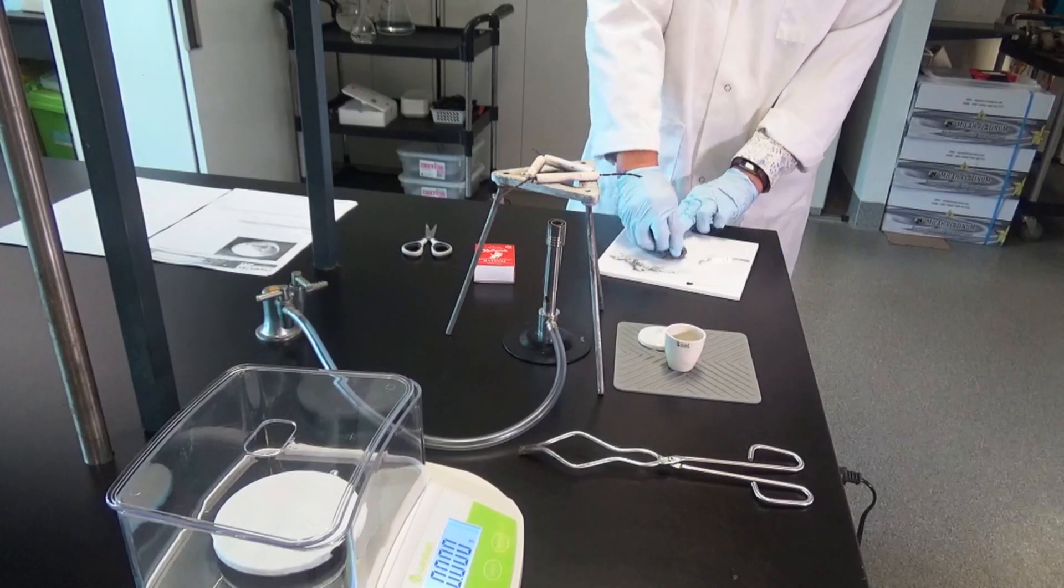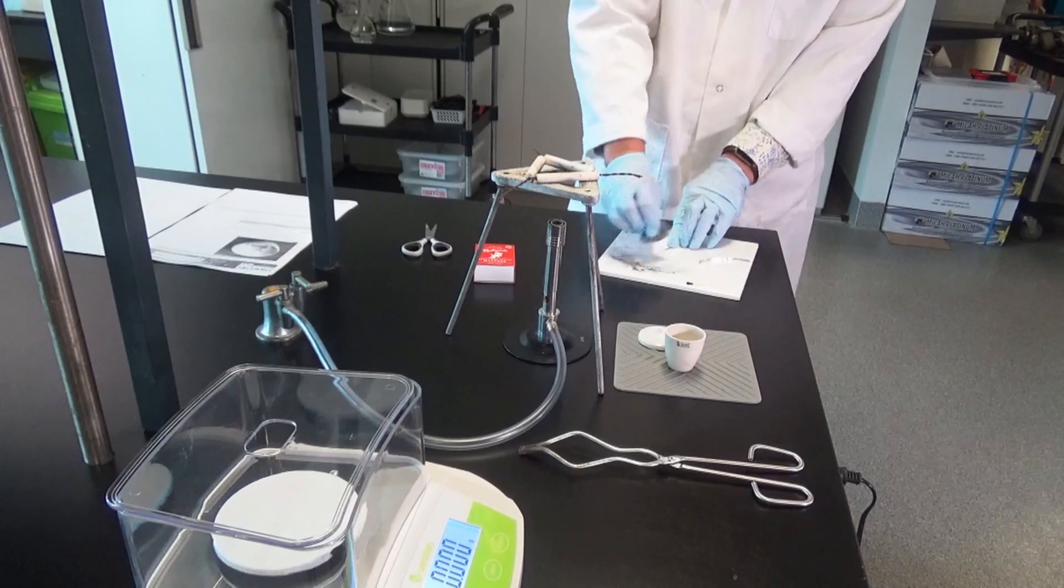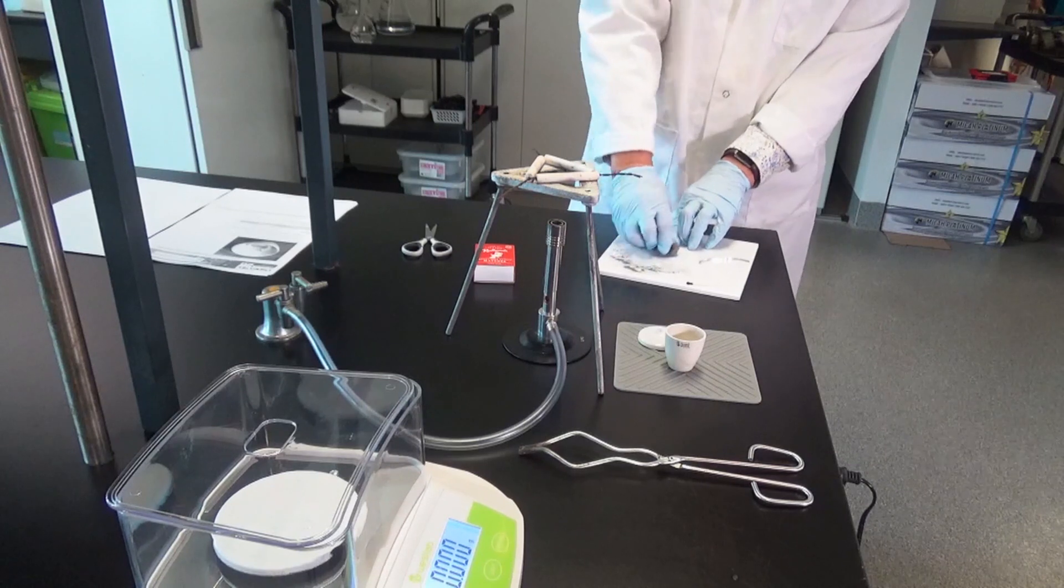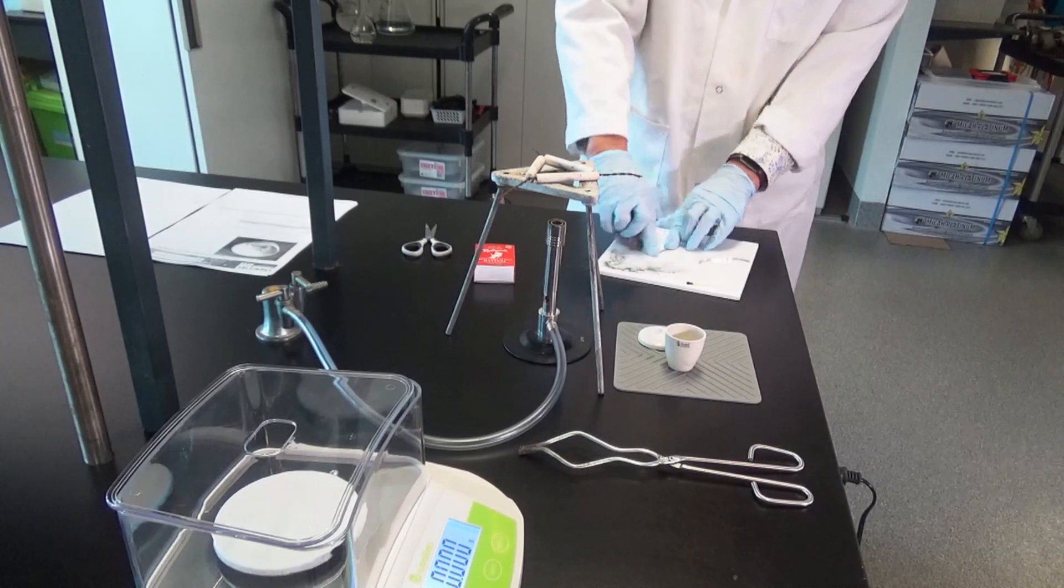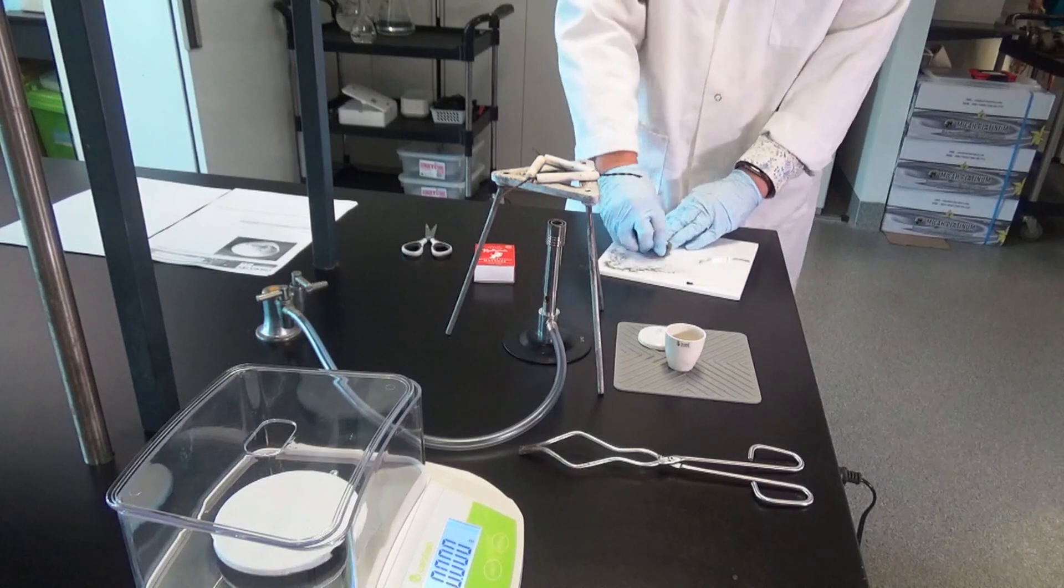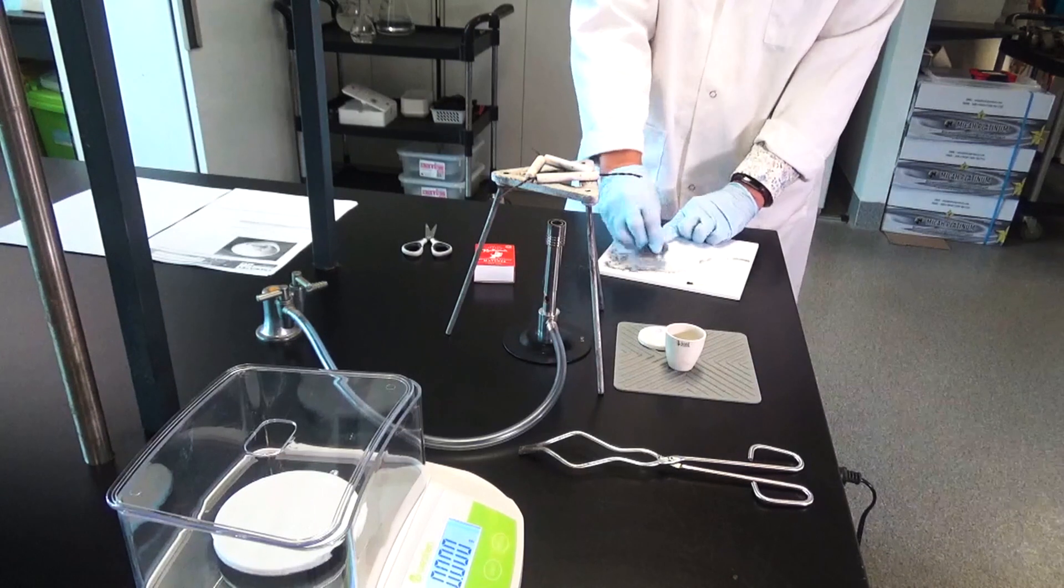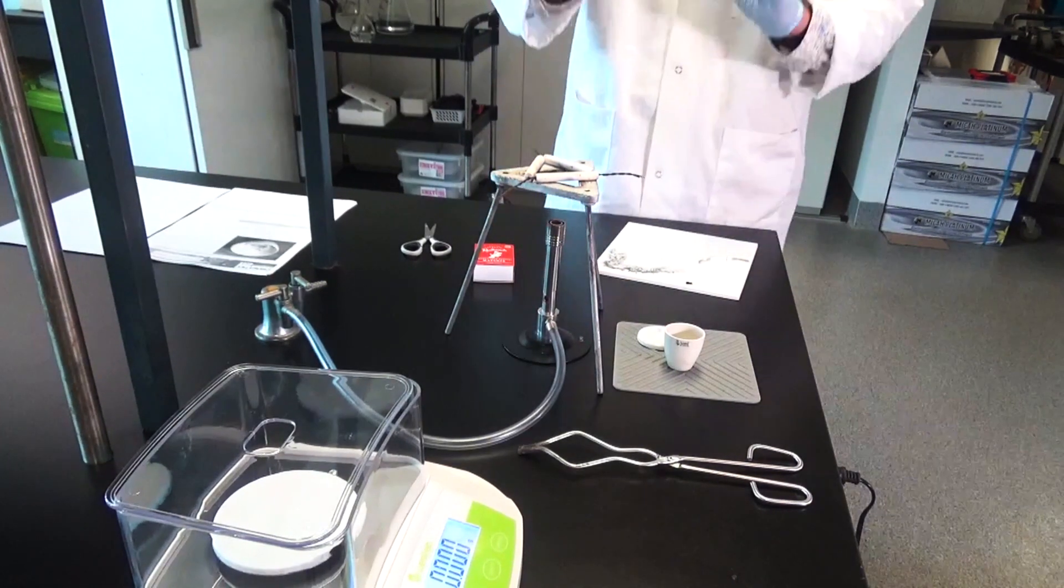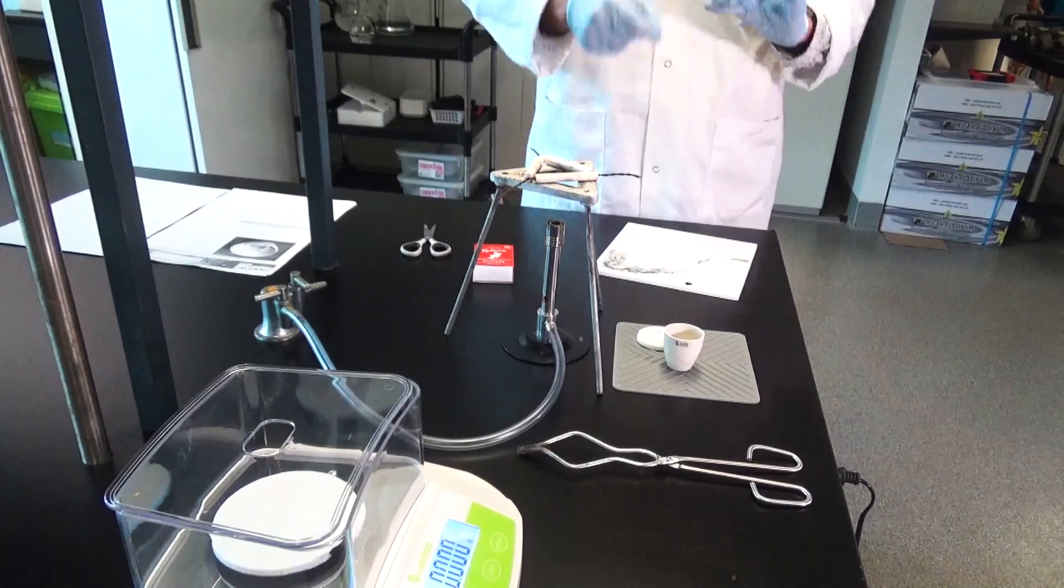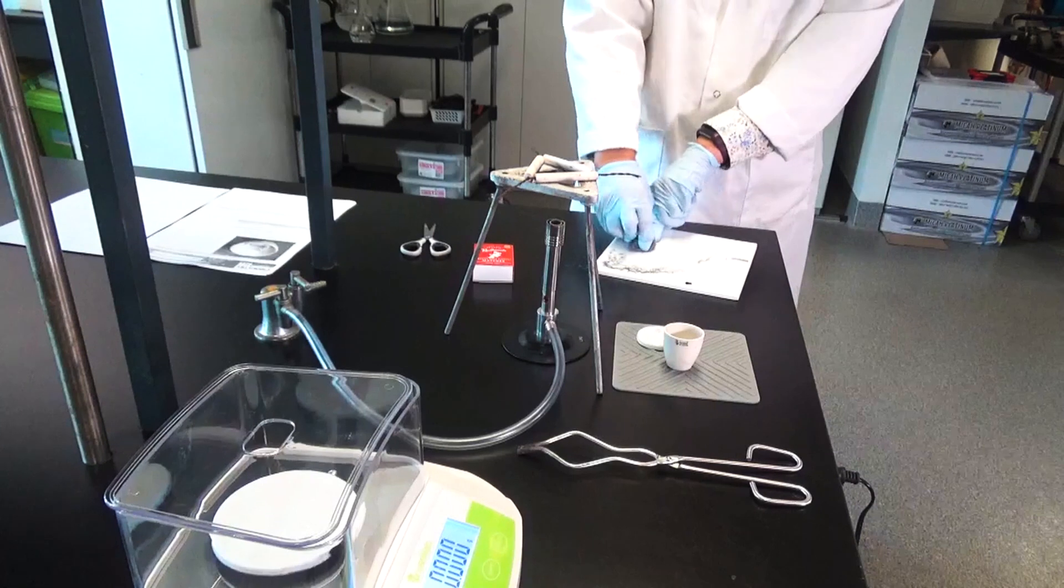So what we've done is we've heated up the crucible so that it's super hot. That would remove any water from the crucible and the same with the lid. We're just waiting for it to cool and then we can get the mass of the crucible and the lid. In the meantime I'm still cleaning magnesium. This is where I wish you guys were here because this is the worst part of the experiment and you usually hold it up to me and I'd go, no not clean enough yet, keep going.